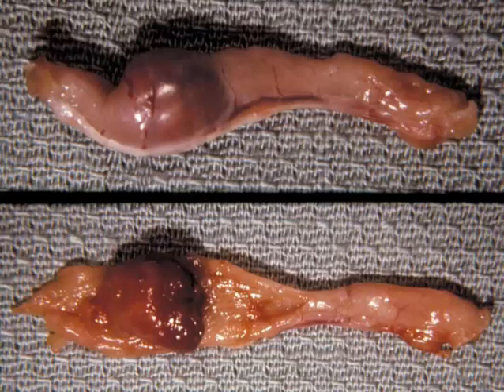The APC-Min mouse is a commonly used intestinal and colonic cancer model which develops multiple intestinal neoplasia, similar to familial colonic polyposis in humans. The APC gene, which is similar to humans with polyposis coli, has been knocked out of these particular mice, and they will readily develop intestinal papillomas, adenomas, and carcinomas due to enhanced expression of the c-Myc oncogene.